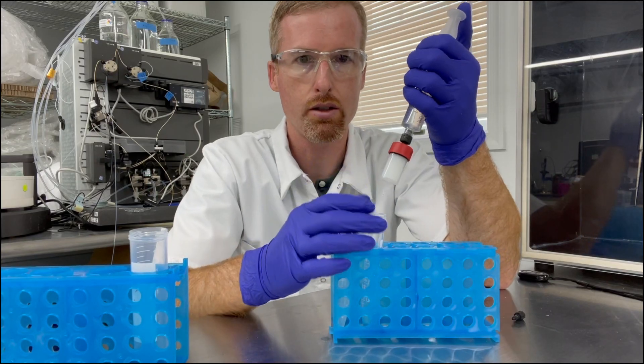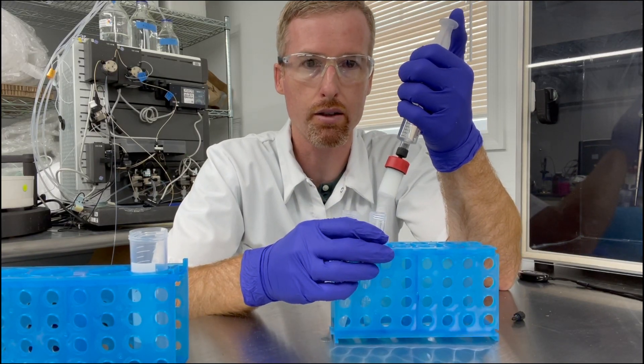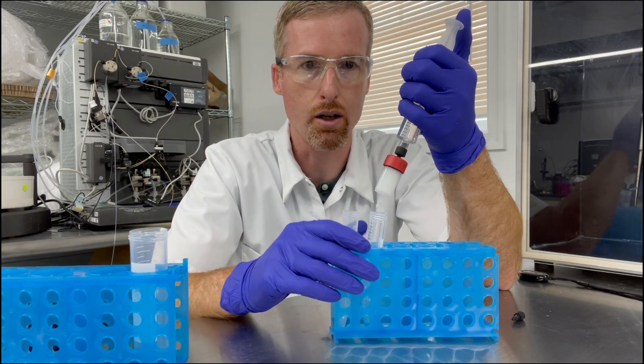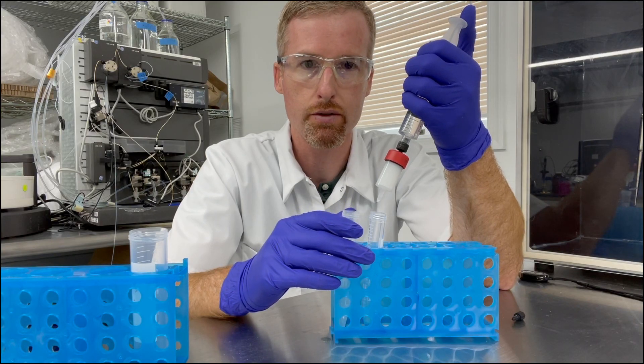And continue flowing into my collection tube to collect the protein for another five mils.